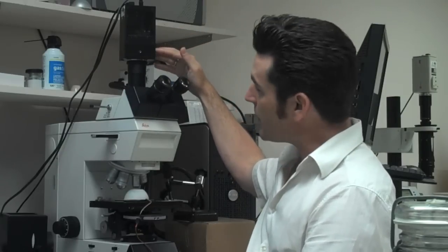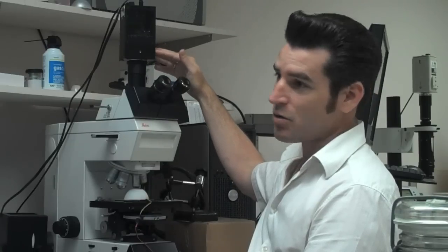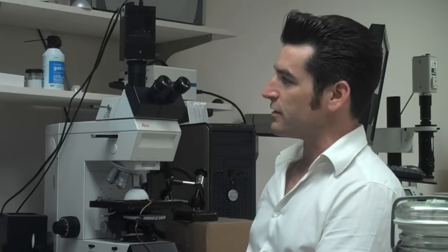This produces the illumination sufficient to actually get the specimen exposed properly to the camera. This particular camera is a Kodak chipset and it's what we, in the industry, call a light hog. It requires quite a bit of photon power to get it to expose properly. And this mini dome with just 20 LEDs is more than enough to get a specimen illuminated for photography.